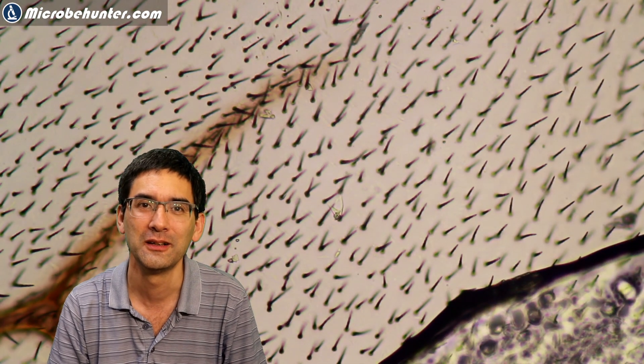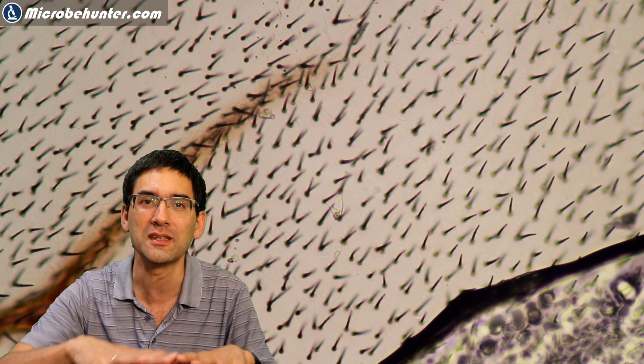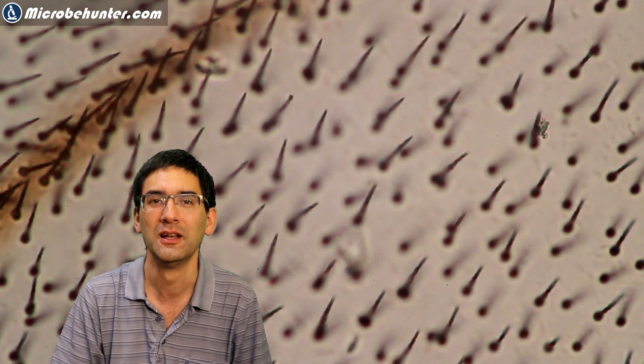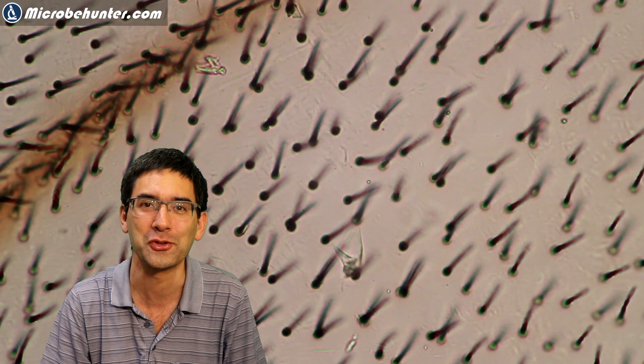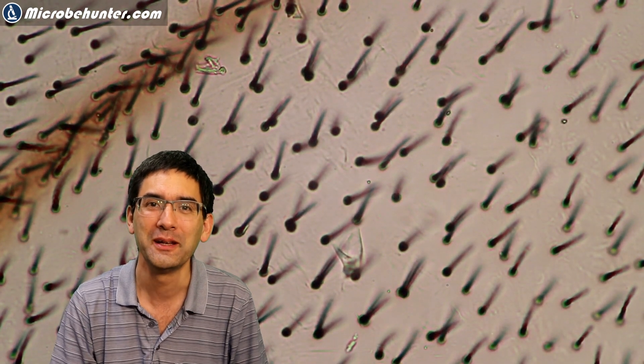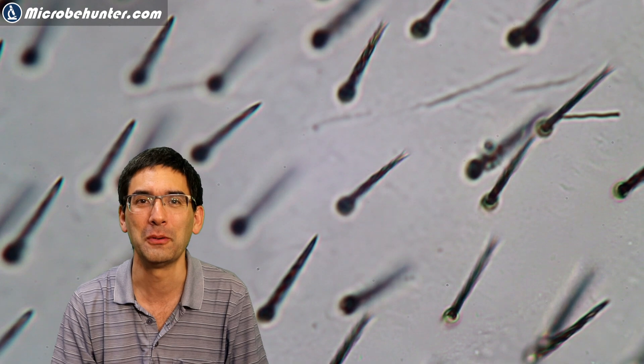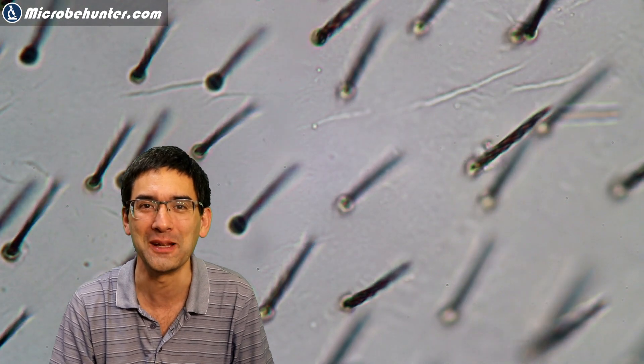Here again, looks quite nice. And the good thing about wings is that they're quite flat and therefore easy to put under the compound microscope. They're also quite transparent. And if it were not for those tiny little hairs, it wouldn't be possible to see the wing maybe in the first place at all.